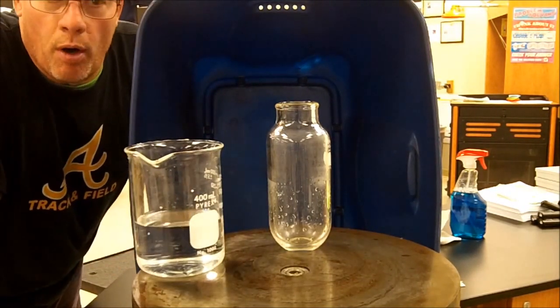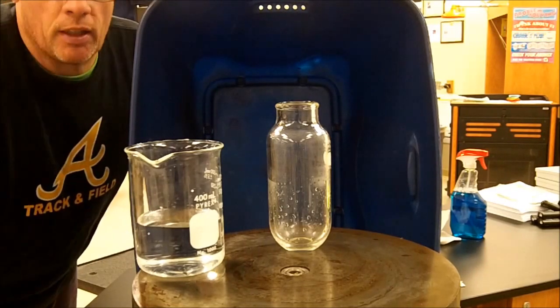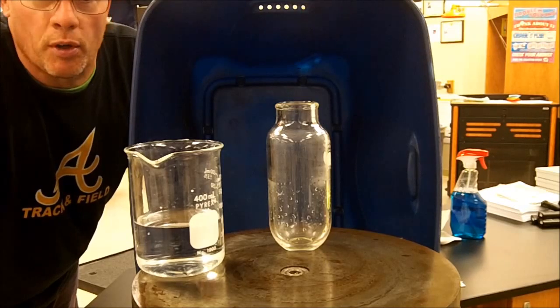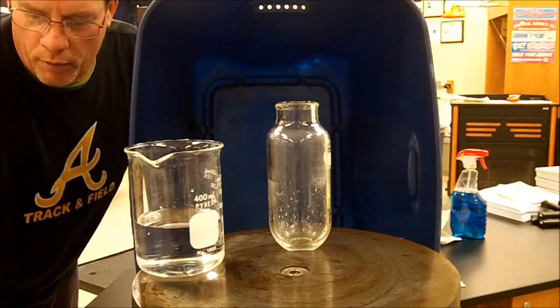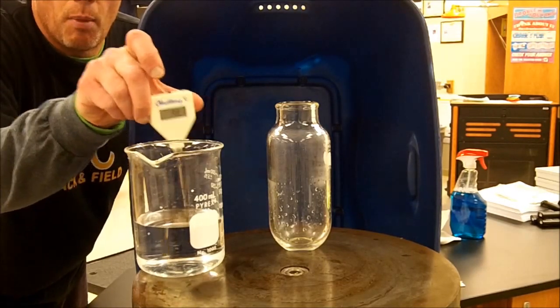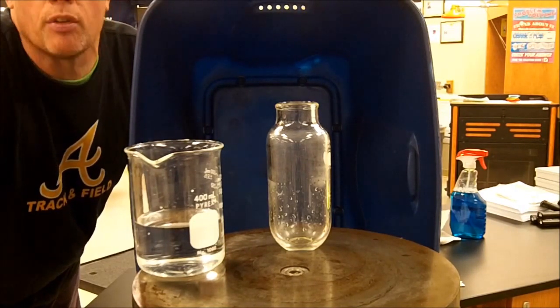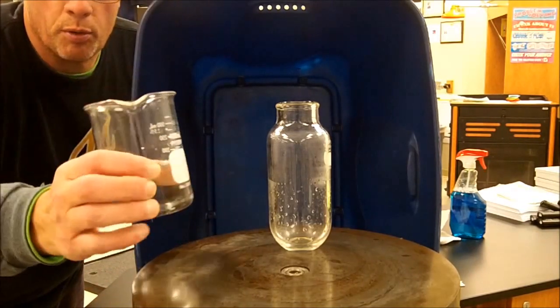I'm going to place that tap water in the container. It's actually kind of an interesting piece of glassware. I'm not sure exactly what that type of glassware is. I will place a digital thermometer in there, and I'll let you see the temperature of the actual water just to prove that it is at room temperature.